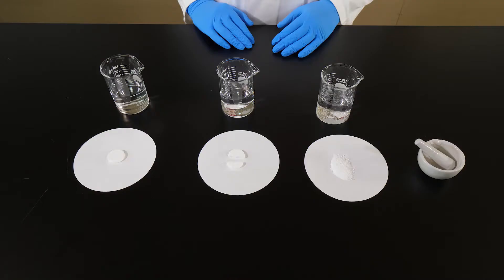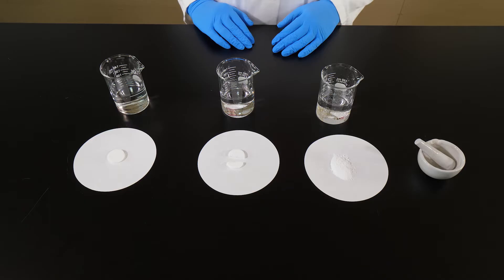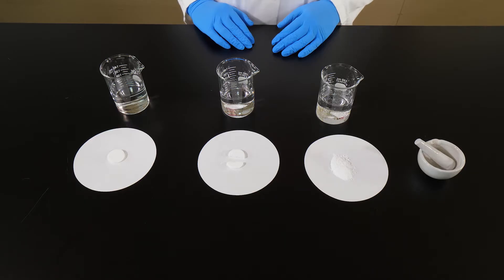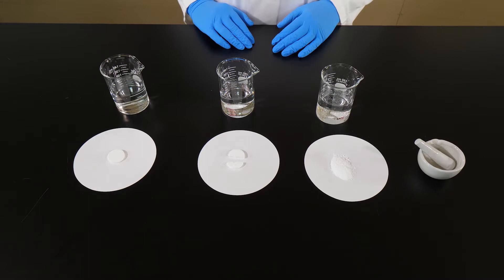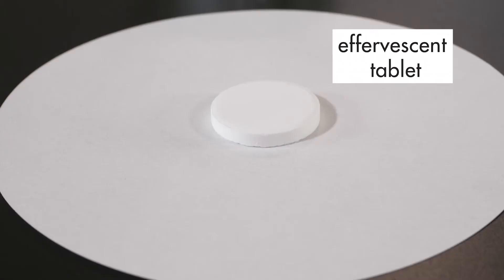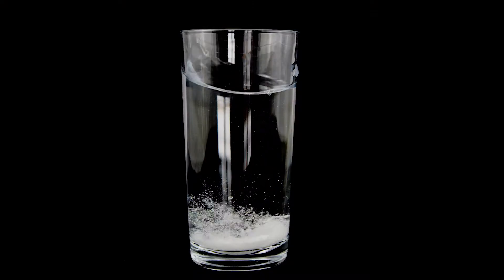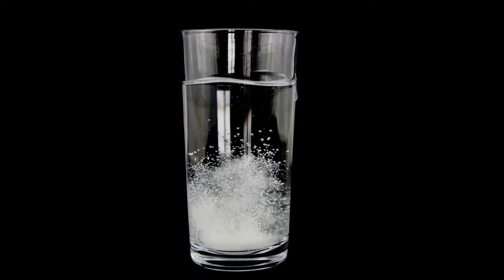Instead of actual food, which takes hours to digest, we will use effervescent tablets, which dissolve more quickly. An effervescent tablet is a hard, round, flat substance that fizzes and dissolves when it is dropped into water.